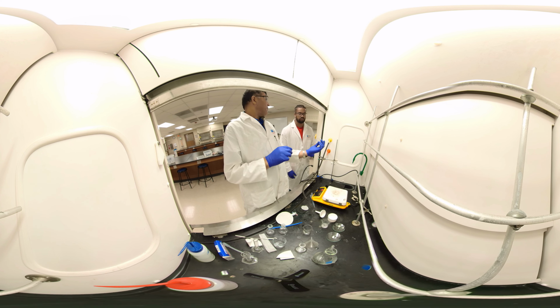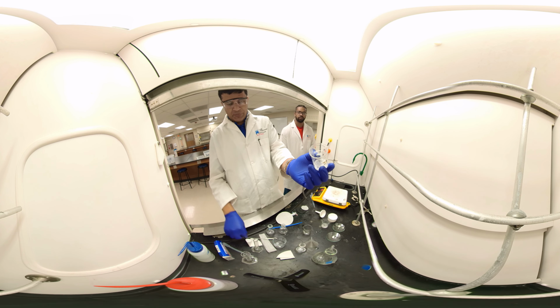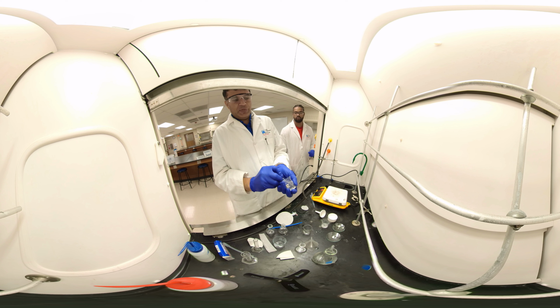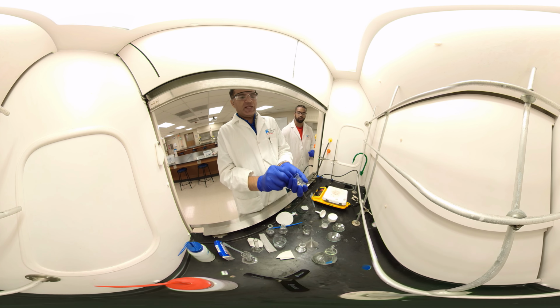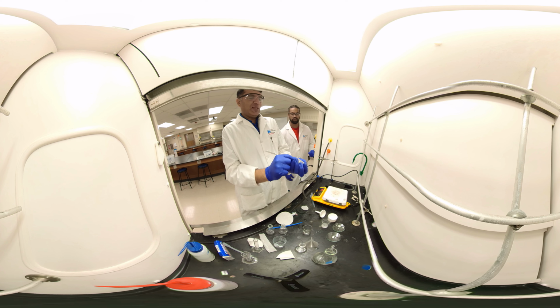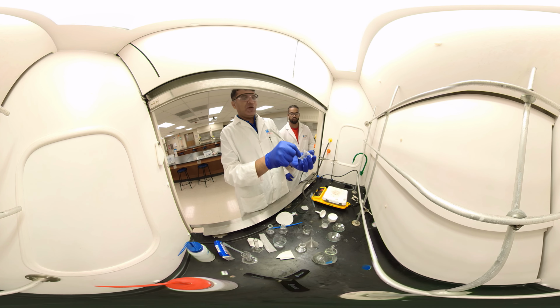Now it's coming, right? The acetaminophen, you can see the solid now. We'll scrape it up. We need to wait a little bit longer. When we are heating, some of the compound may melt, and once it melts, it takes time to settle. So, one more time, while you are heating, you need to be really slow, not too fast. You will burn everything. But here we got really nice acetaminophen, what it should be. And I don't know any better way than to scrape up the chemical and weigh it out.